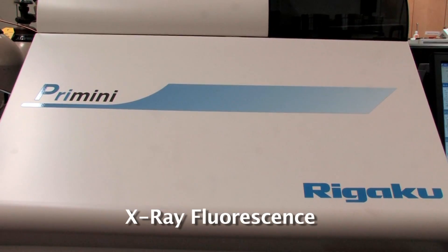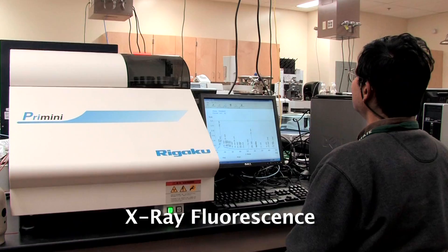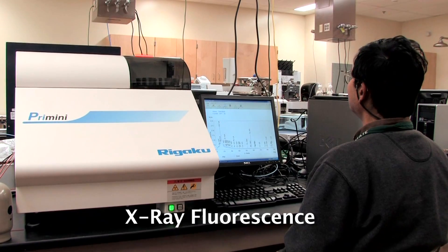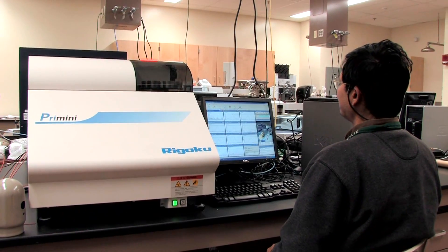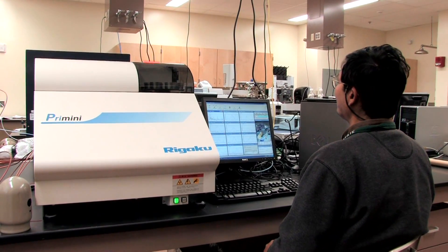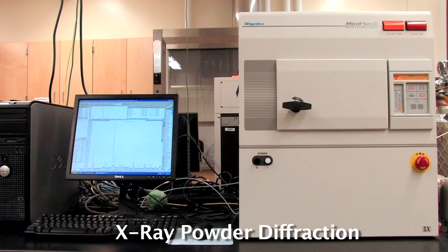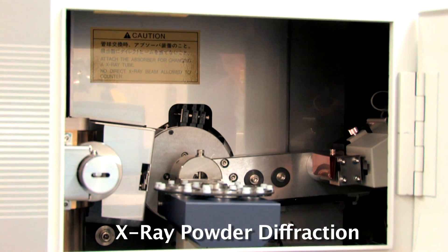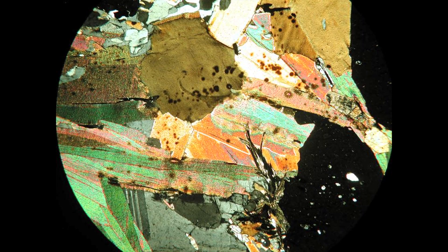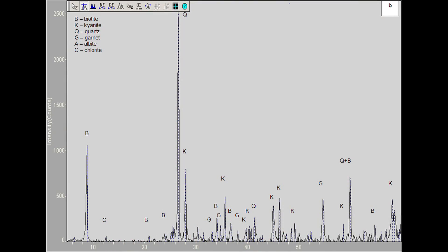X-ray fluorescence is used to determine metal elements and their metal oxides from powdered rocks, soils, and minerals. X-ray powder diffraction is used to determine structural information on materials, as well as providing some utility in determining elemental composition.